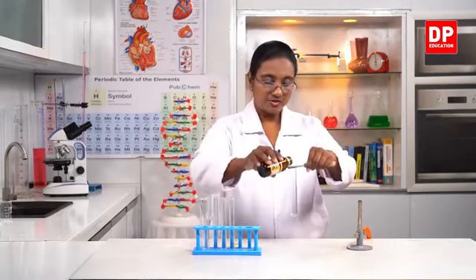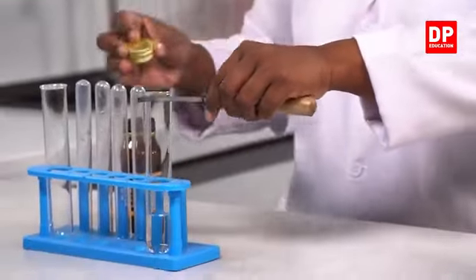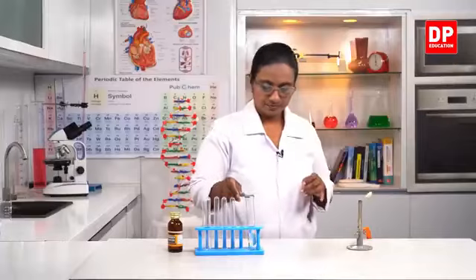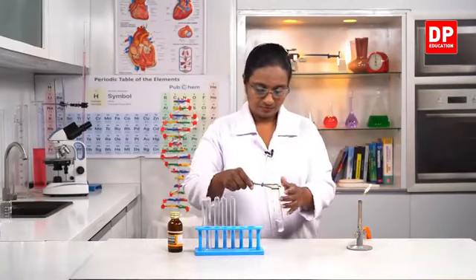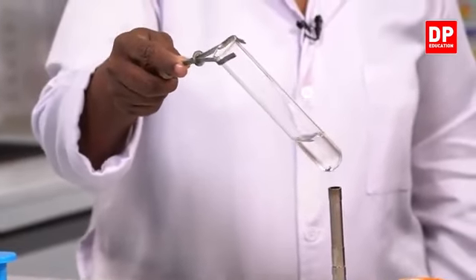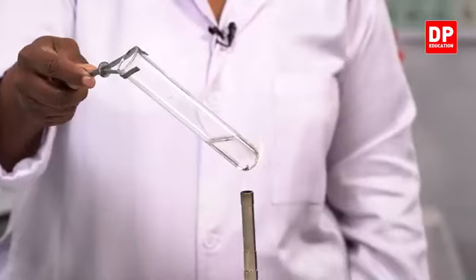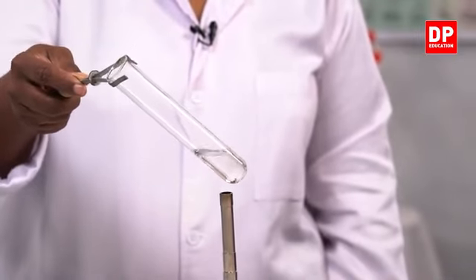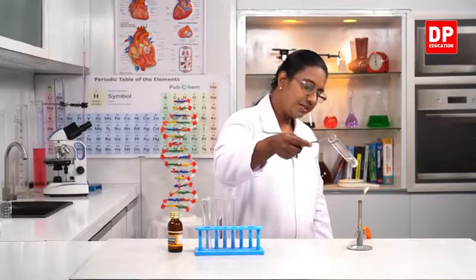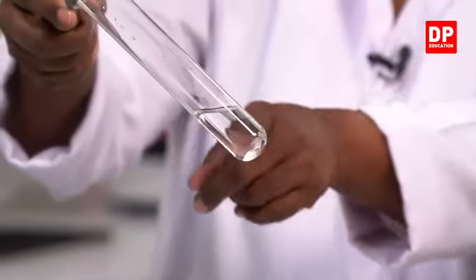So here I am going to take a small amount of hydrogen peroxide. Then we need to heat it. So I am going to heat this hydrogen peroxide. You all have to observe clearly, students, what happens there on heating. Can you all see the formation of gas bubbles at the bottom? There from the bottom you all can see, students.